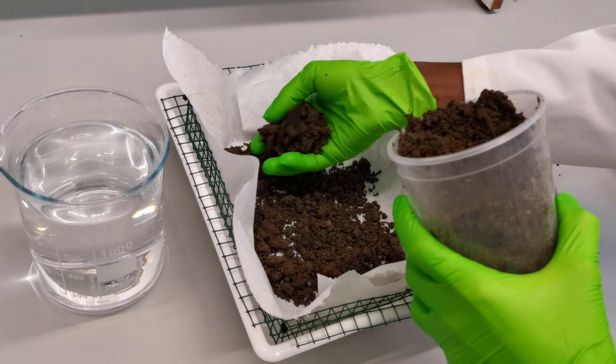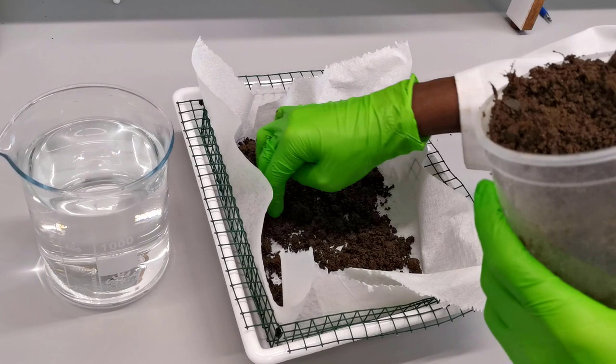Also remember, instead of soil, plant root materials can also be used for extracting vermiform motile nematodes with this technique, but sedentary nematodes will not be extracted as this technique is based on the motility of nematodes.